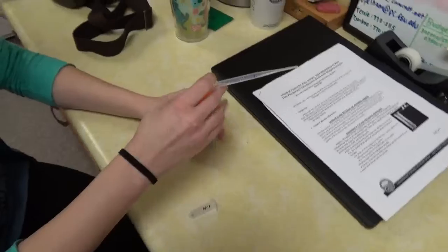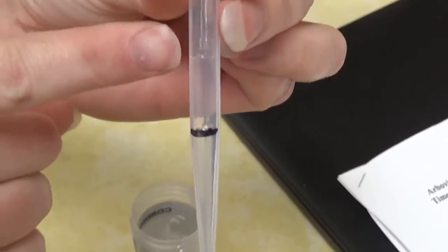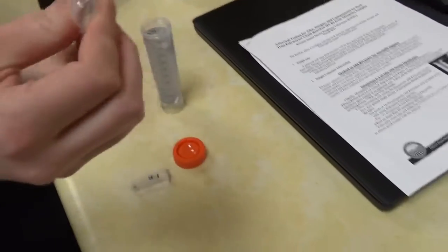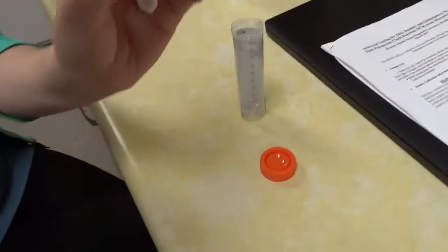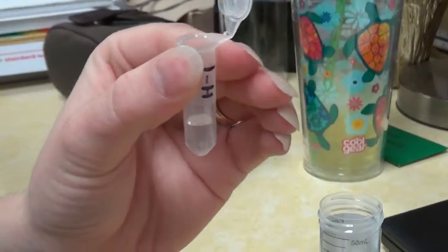So you have your pipette, and the first tick mark is going to be ½ ml, and then the next one will be 1 ml, and you'll just suck up ½ ml from your little glass vials that I gave you. And in the chilled Zika mosquito vial, you'll put the ½ ml. Alright, so that's how much it filled up.